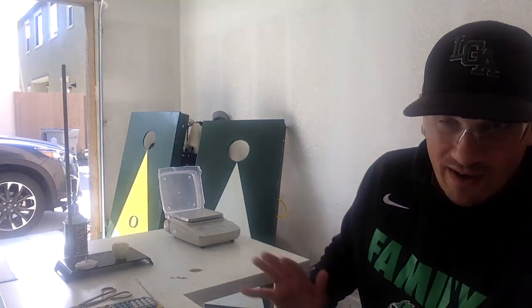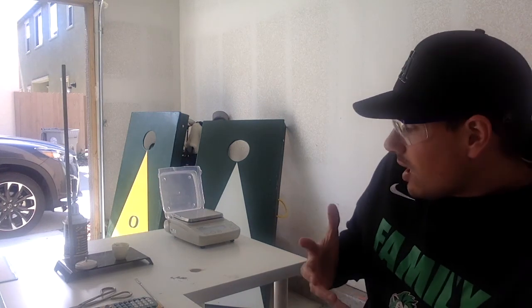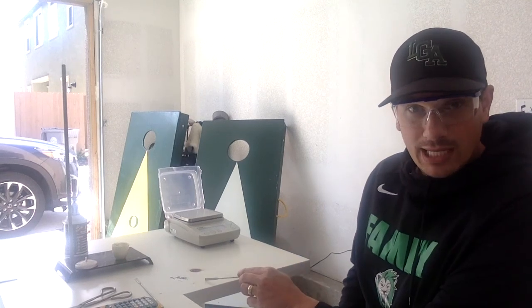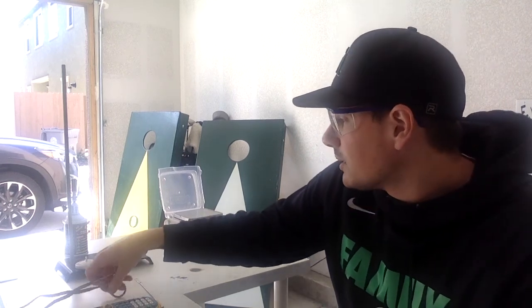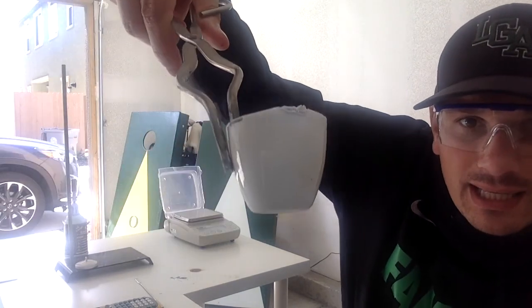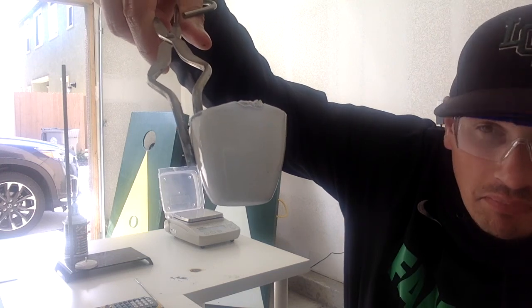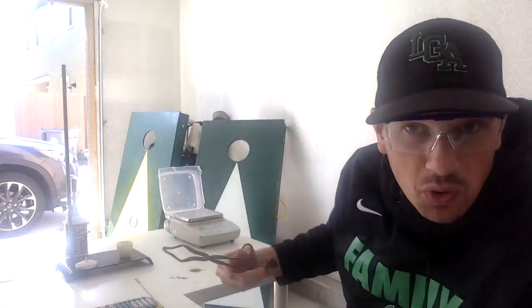But some fun facts while this cools down a little bit. So I dropped it right on my desktop, so you can see right here, that's a little burn mark for me. Whoops. So it was so hot, the crucible actually, let me show you guys something. Right here, you can see that the crucible looks like it was bitten. That's the magnesium that actually melted the porcelain part of that crucible. Cool thing. So it got super, super hot.